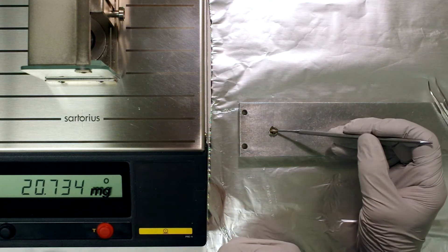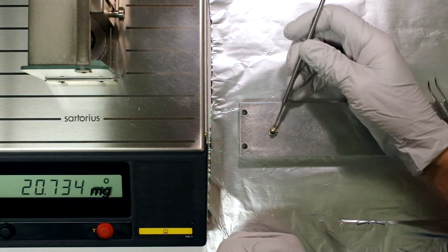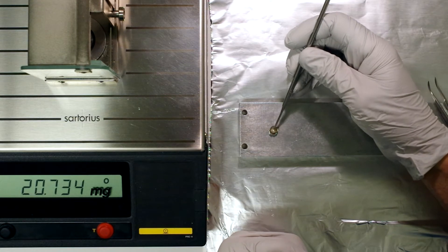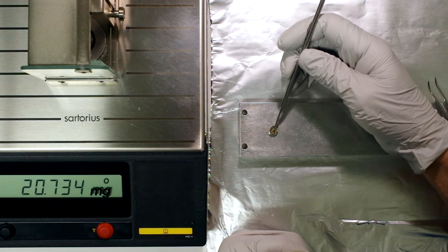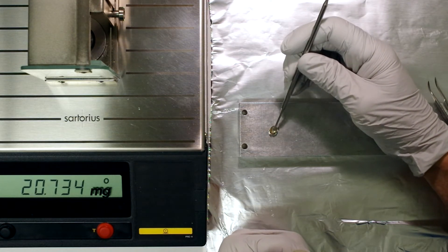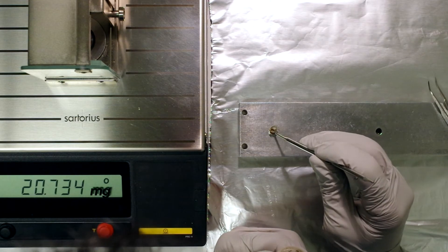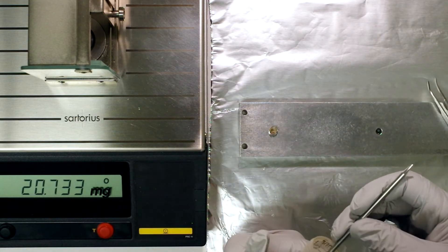The trick to loading large amounts is to gently tamp it down and compress the mineral material into the capsule. I'll do this as I go.